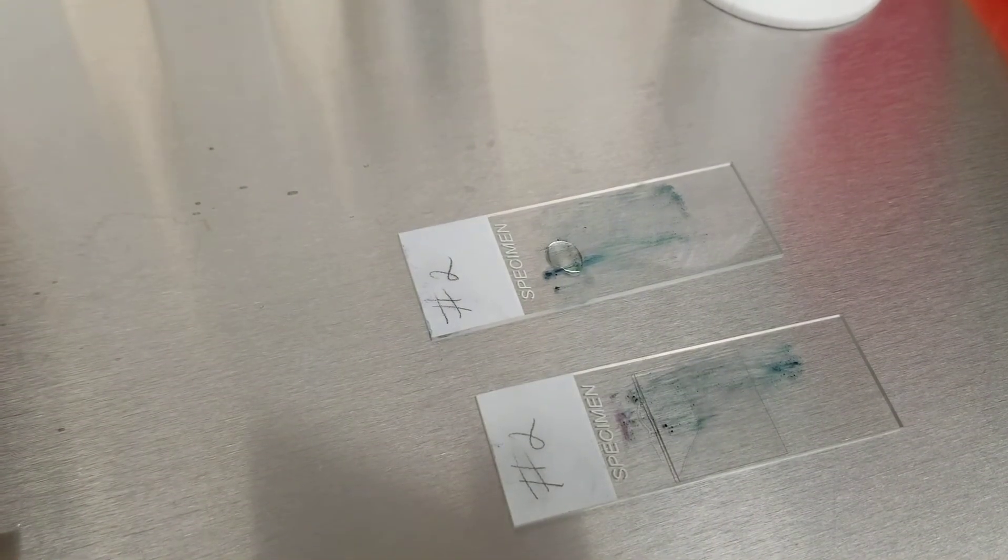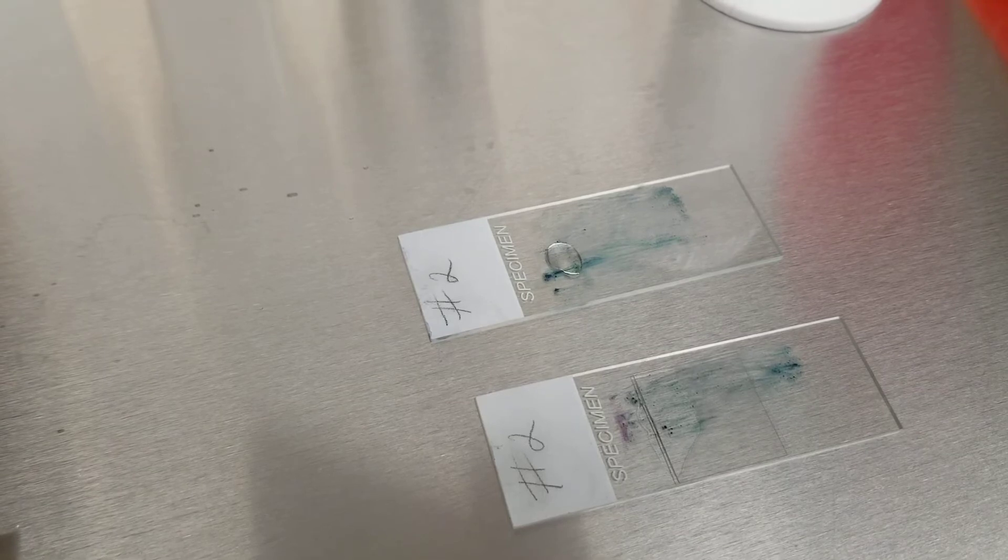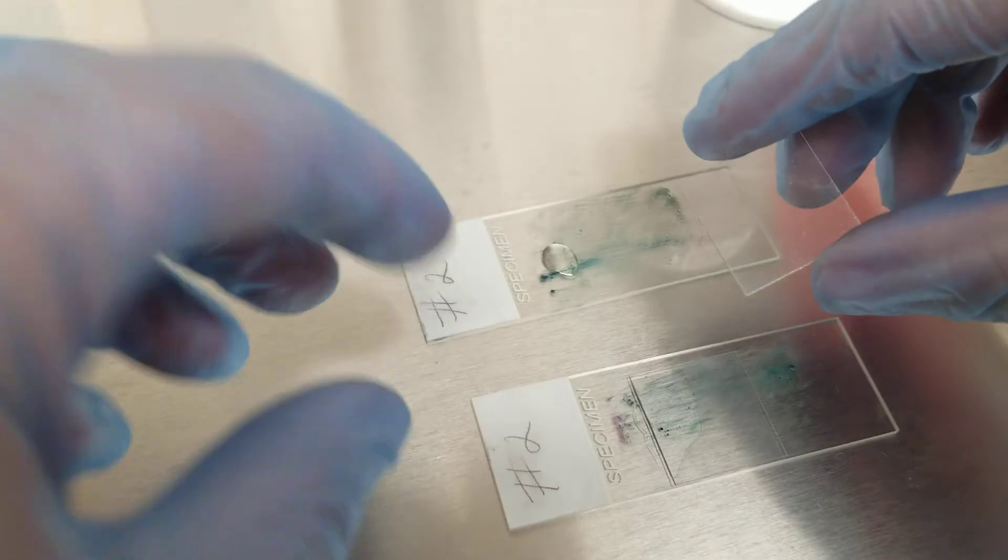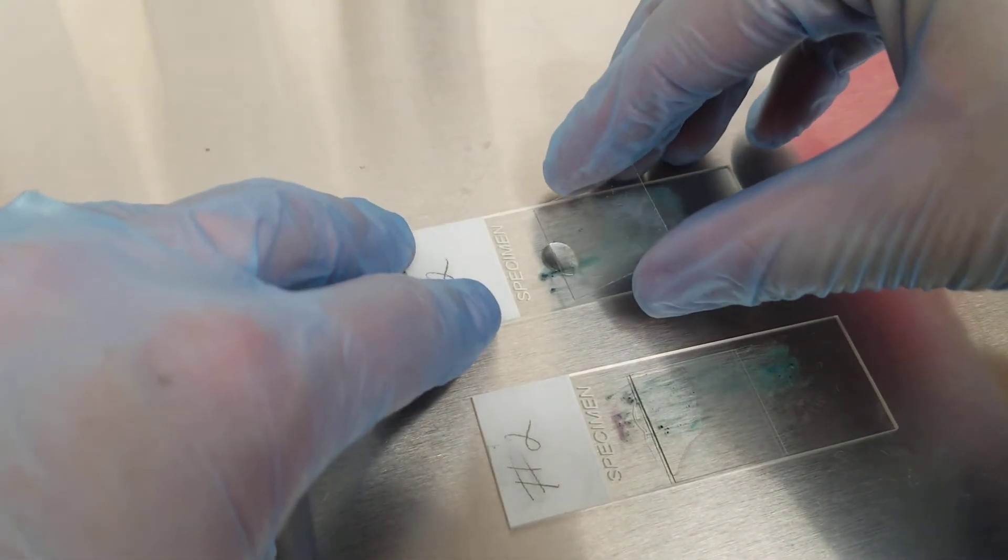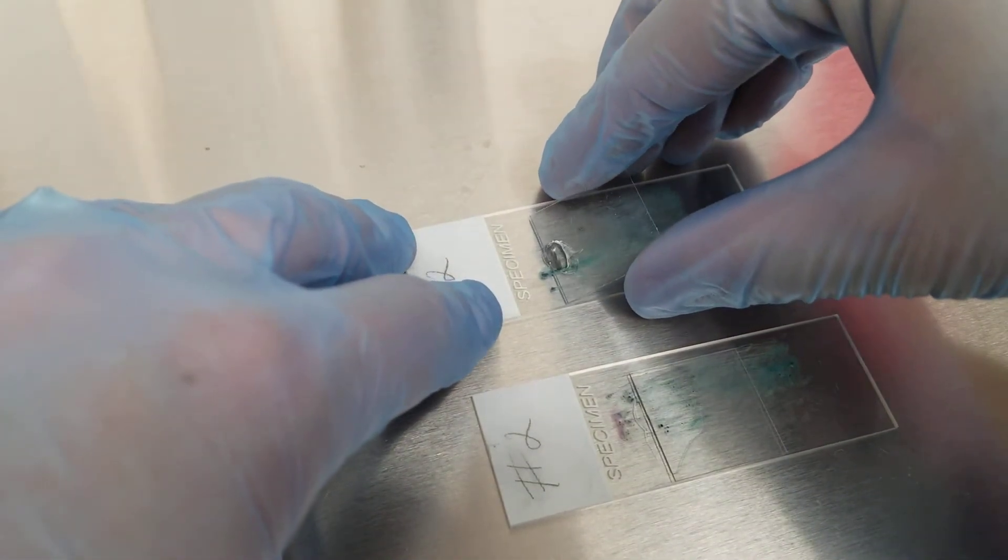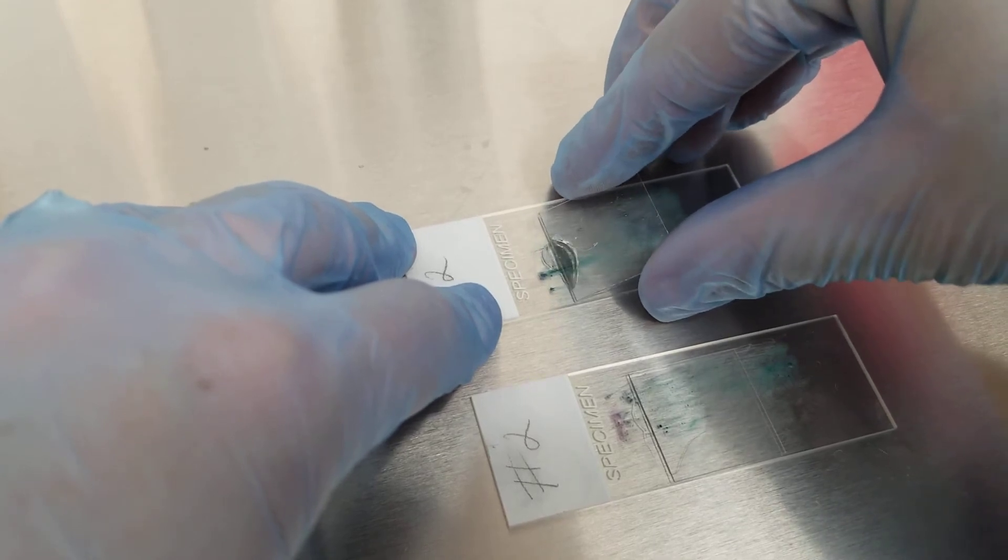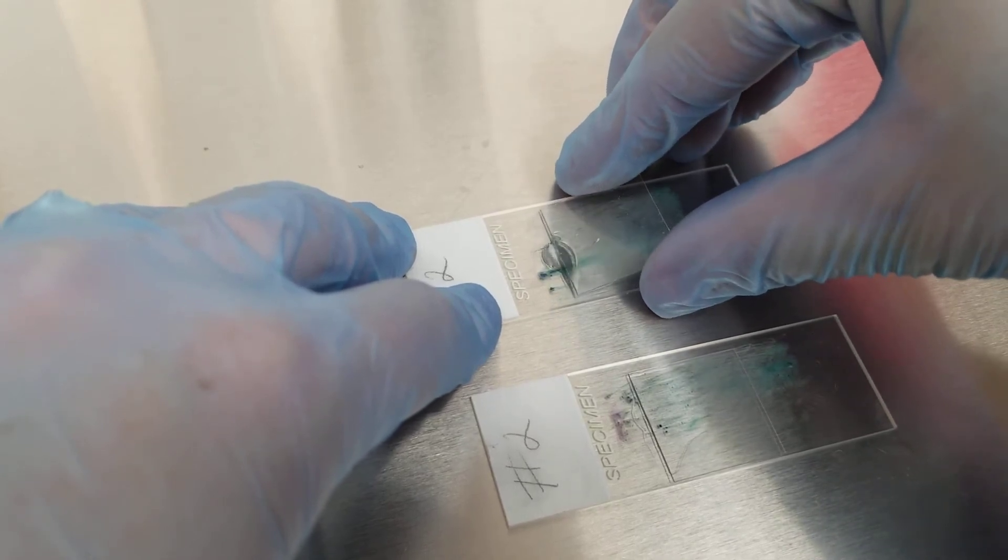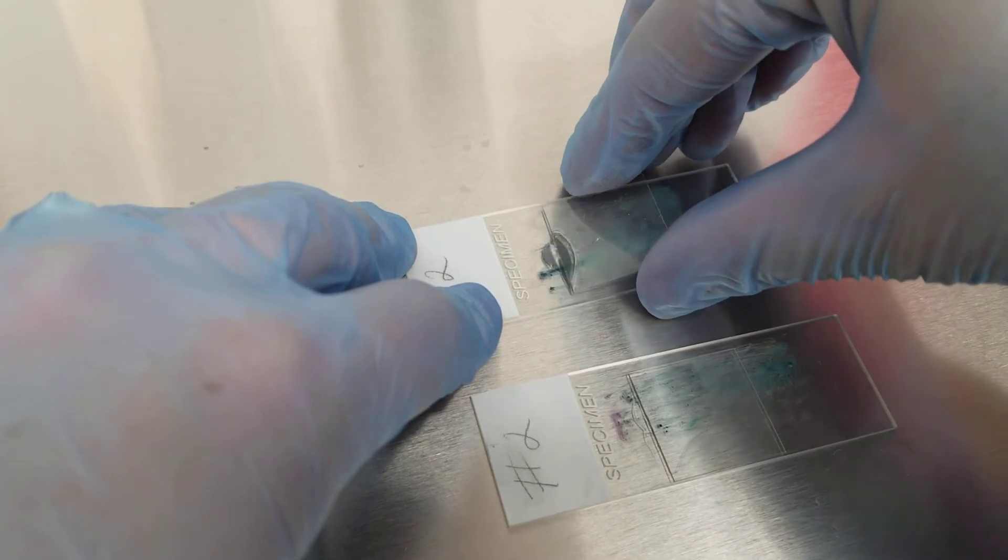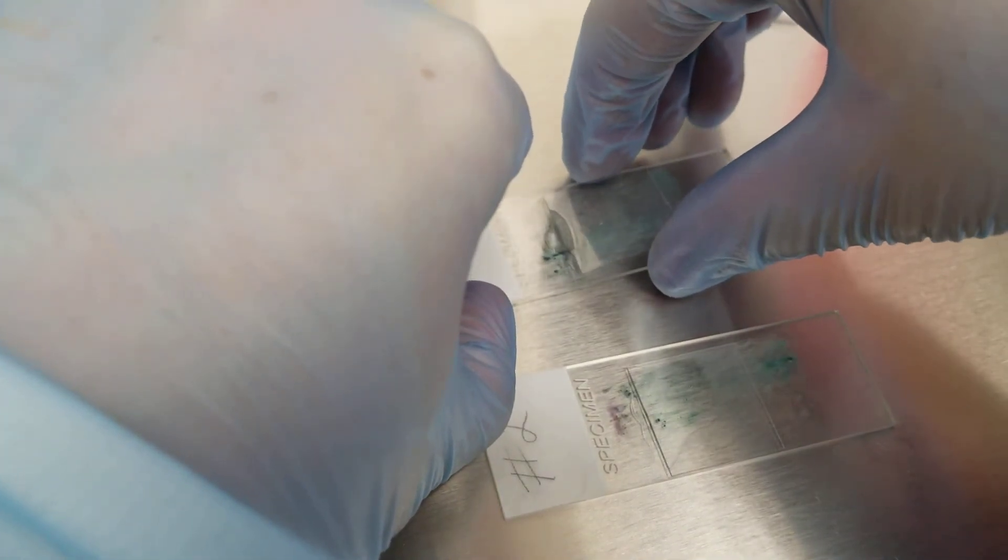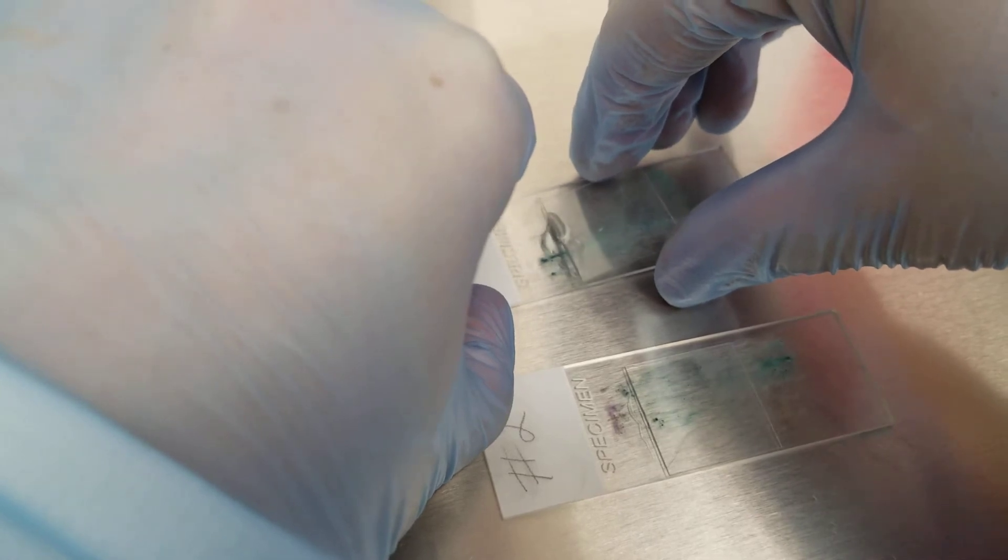But of course, the coverslip rather, things might not work for me today because we're filming. So that's what I'm doing with both of these. I put one drop on there and I'm going to let it travel up the side of the coverslip, which it doesn't seem to want to do because you're watching.